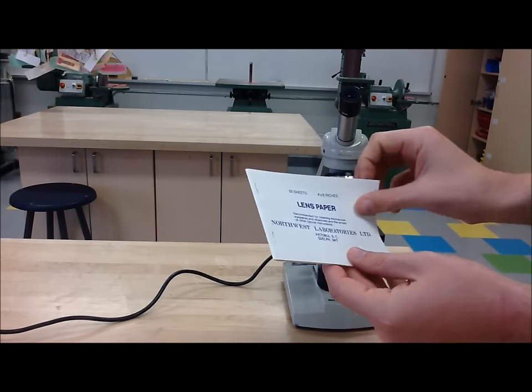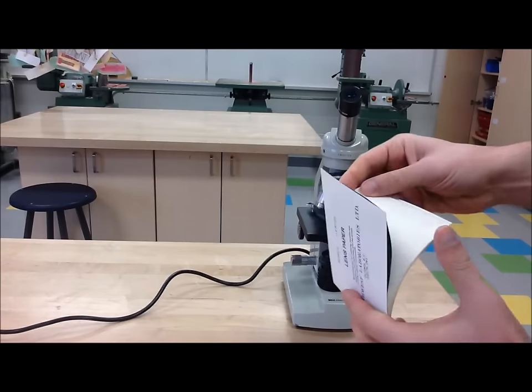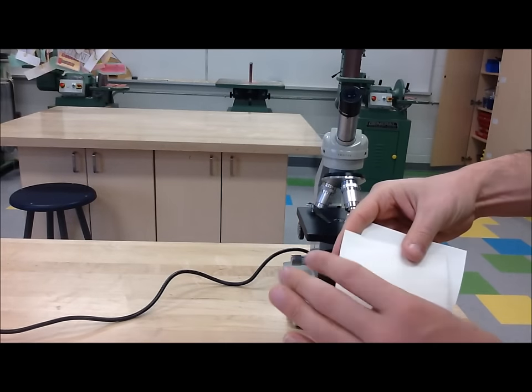Step 3: Clean the lenses using a soft cloth or lens paper.